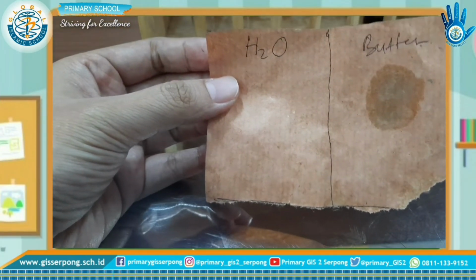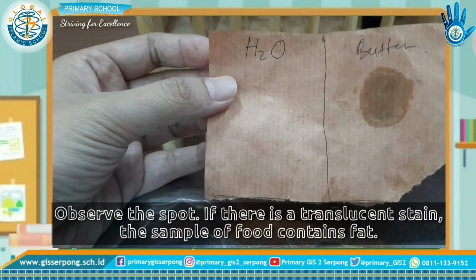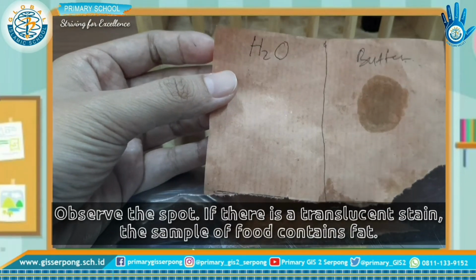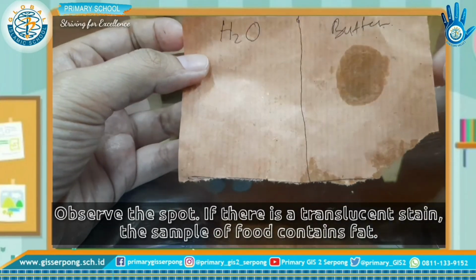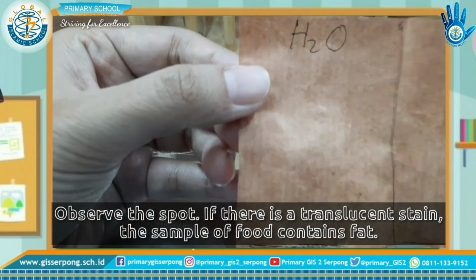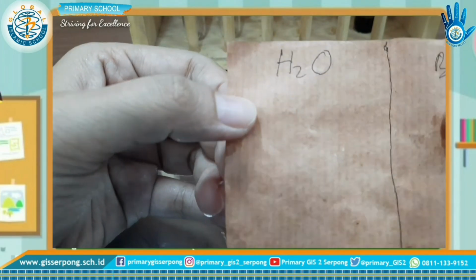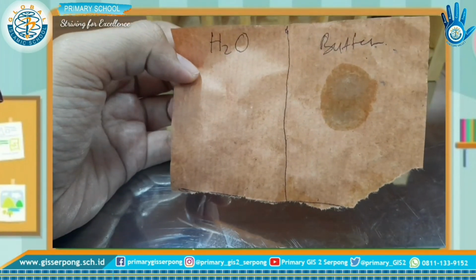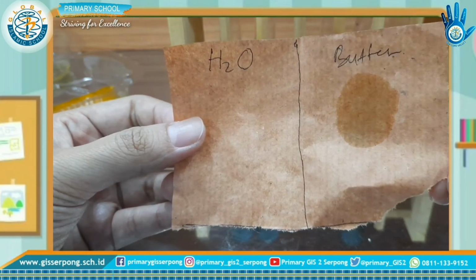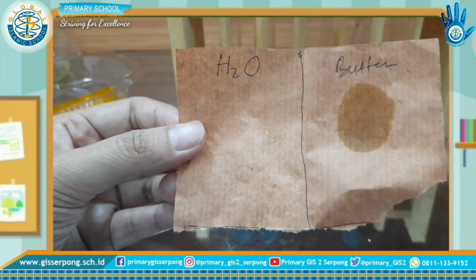After 5 minutes, observe the spot. If there is appearance of translucent stain, then presence of fat is confirmed, like butter. You can see the water on the sample of water, cannot see translucent stain. So with this result, the fat is confirmed in the sample of food.